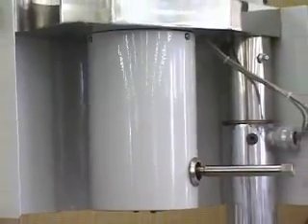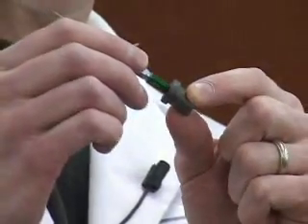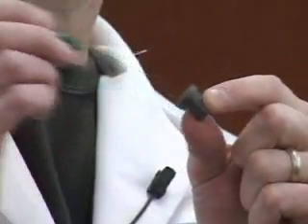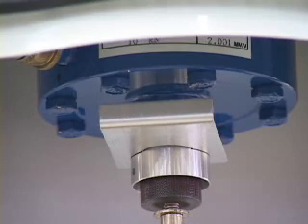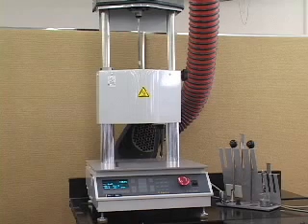It consists of a heated barrel into which a material is placed and melted, a capillary to which the polymer melt is extruded, a load cell or pressure transducer to measure the force required to extrude the melt, and a motor to force the extrudate through the capillary at single or multiple shear rates.